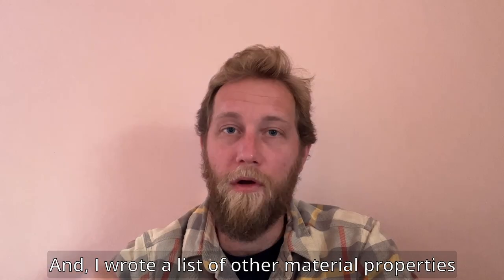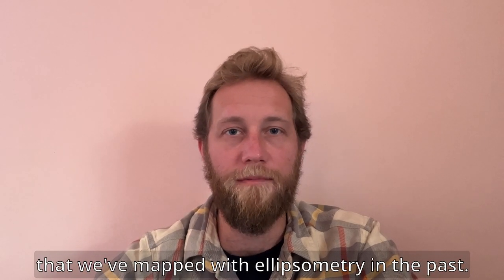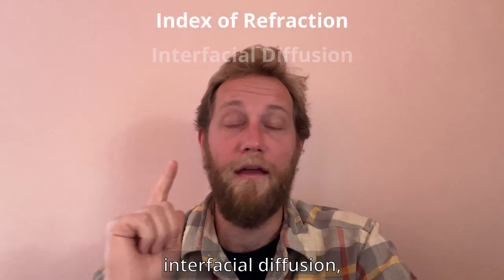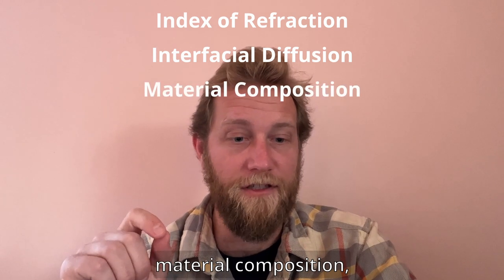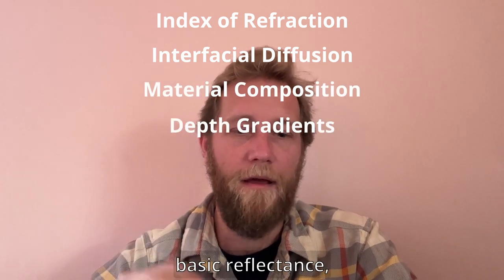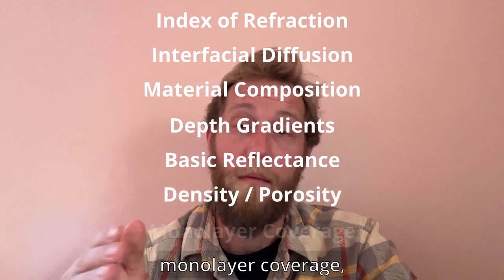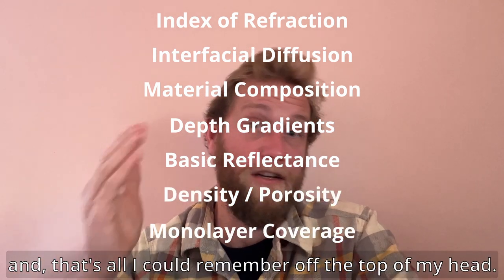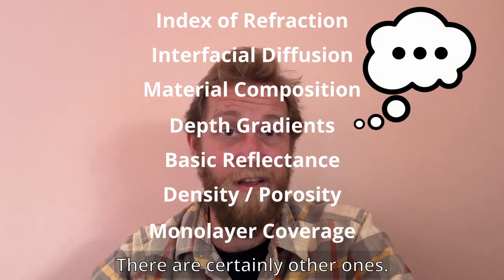I put together a list of other material properties that we've mapped with ellipsometry in the past: index of refraction, interfacial diffusion, material composition, depth gradients, basic reflectance, density and porosity, and monolayer coverage. That's all I can remember off the top of my head — there are certainly other ones.